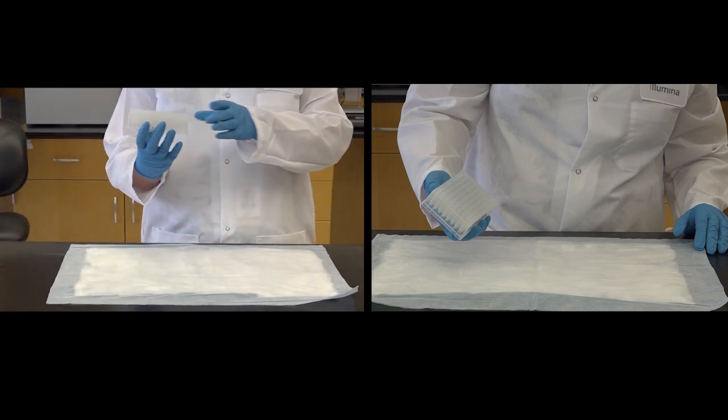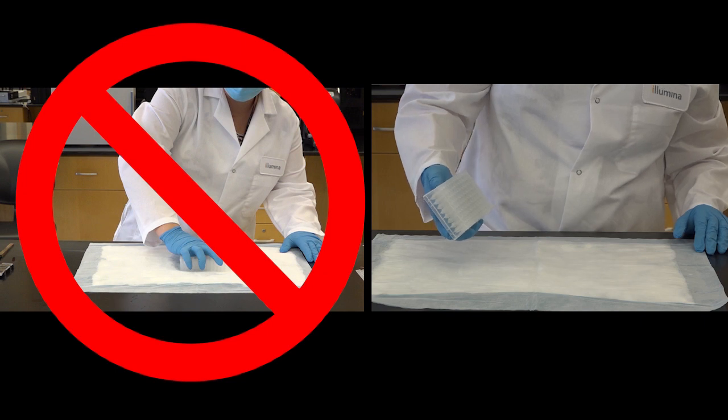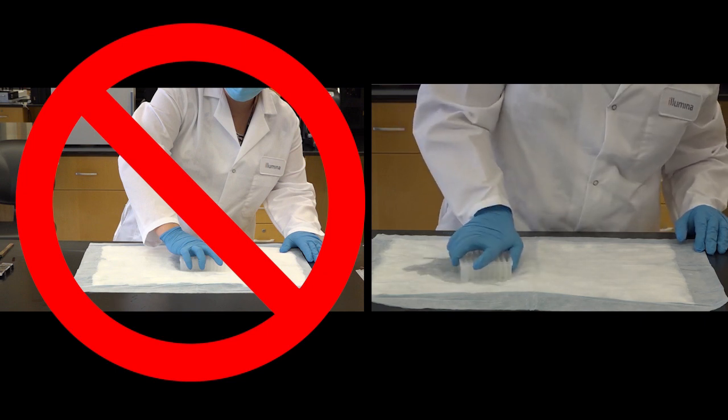Be sure to avoid a large looping motion as this can potentially loosen the pellet. Also, avoid slowly inverting the plate as this can lead to cross contamination.